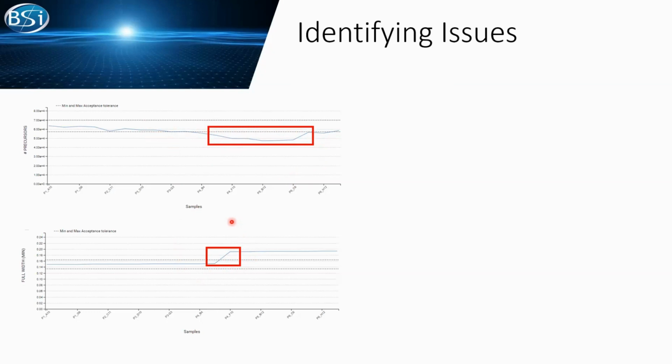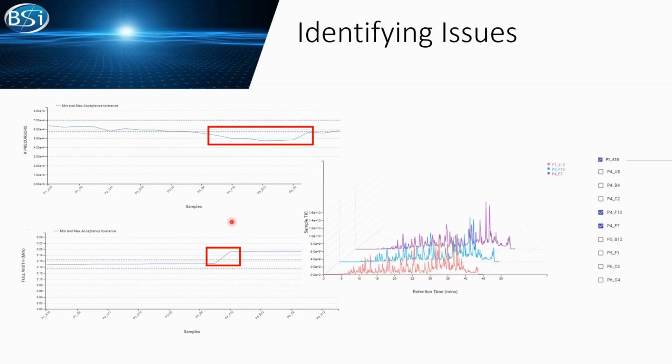We all know that even when doing experiments, things may not go our way, and occasionally many errors can show up at the same time. Can something else go wrong? In here, we give a TIC chart where we select our control sample as well as the failed samples. We can see their TIC level. From their TIC chromatograms, there's no major difference. At least we probably see something missing in the first 5 to 20 minutes, but no more than that.